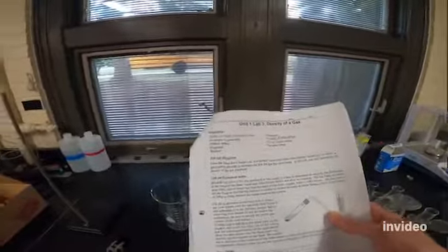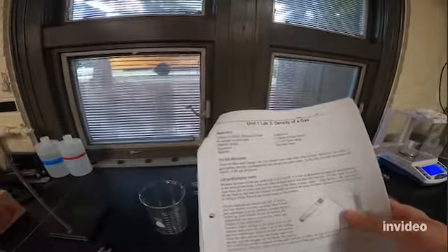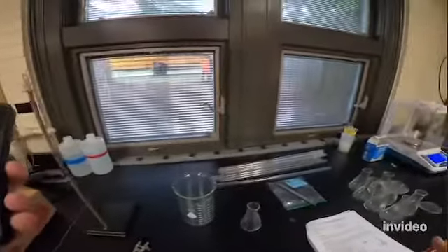All right, guys, we are gonna do the density of a gas lab. So I'm not gonna be here, so you guys are gonna have to figure this out on your own, but I'm gonna show you what you need to do. So this lab is on page 29. And I'm gonna leave everything that you need over here on this counter. So let me just kind of walk you through how you're gonna set this up.